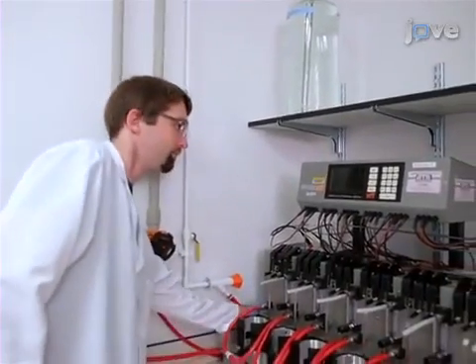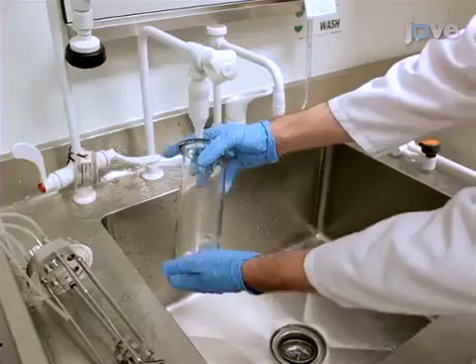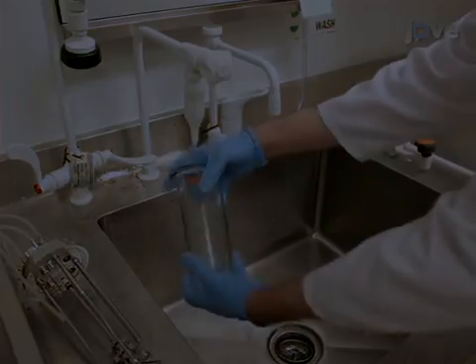Begin this procedure by first turning on the system using the main switch. Next, thoroughly rinse the chemostat vessel.